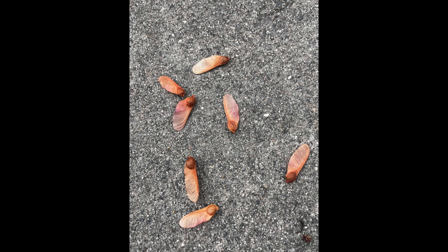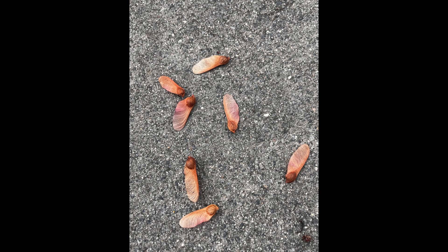Have you ever watched an insect fly through the air? How about a maple seed as it gets carried by the wind and floats gently to the ground? Is there anything similar about wings and leaves on a microscopic level that contributes to the ability to fly? Let's take a closer look at these structures under a Foldscope to see.